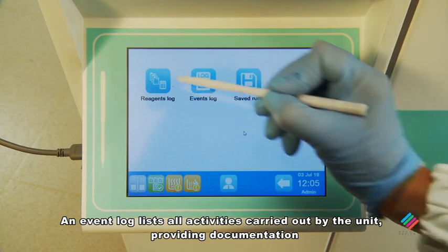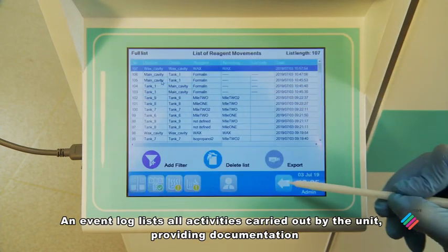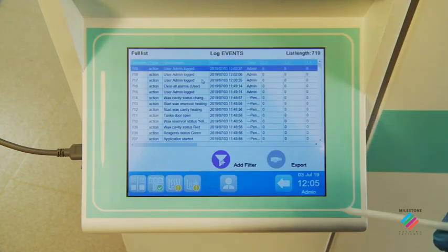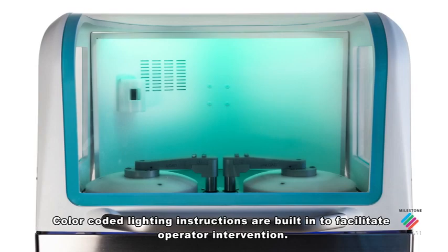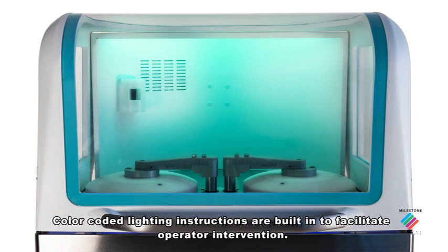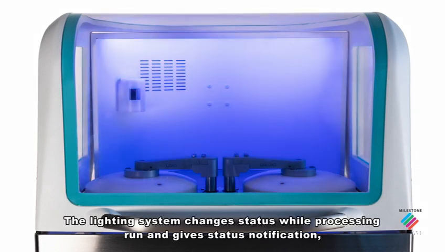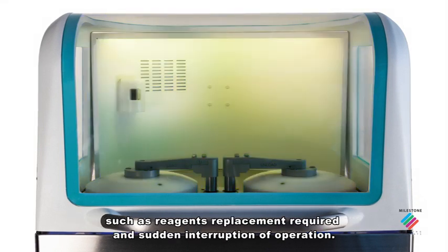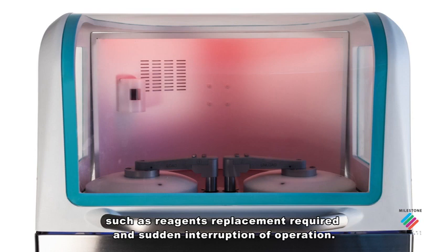An event log lists all activities carried out by the unit, providing documentation for service and quality assurance purposes. Color-coded lighting instructions are built in to facilitate operator intervention. The lighting system changes status while processing runs and gives status notifications, such as reagent replacement requirements and sudden interruption of operation.